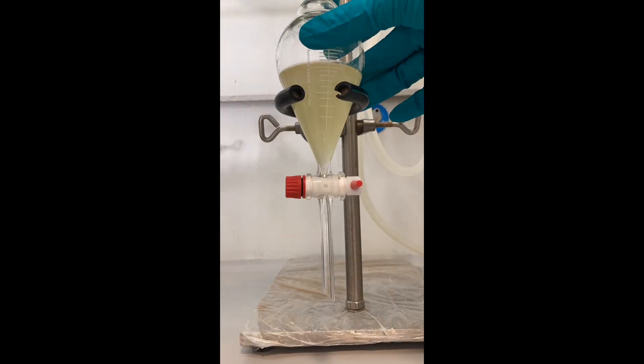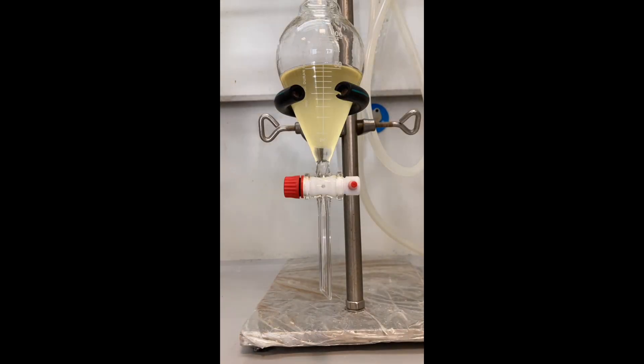After the reaction was completed, I evaporated the solvent and the crude residue was taken up with ethyl acetate. I then rinsed the organic layer with water and brine.